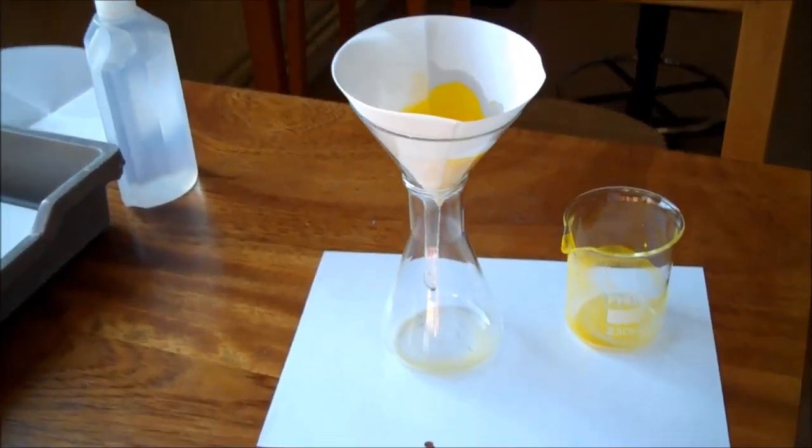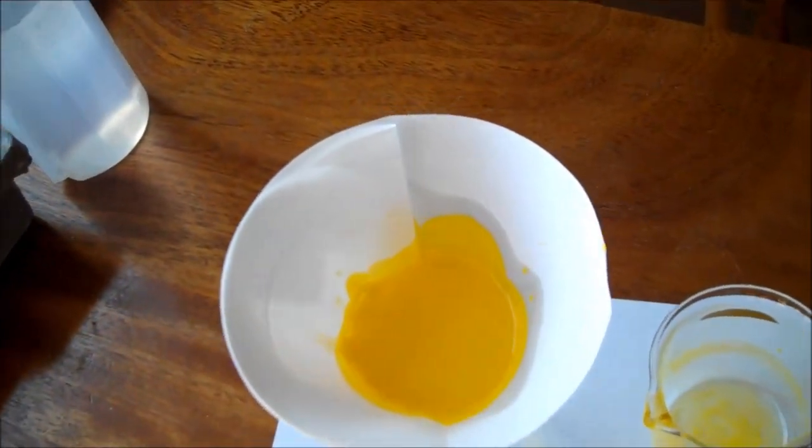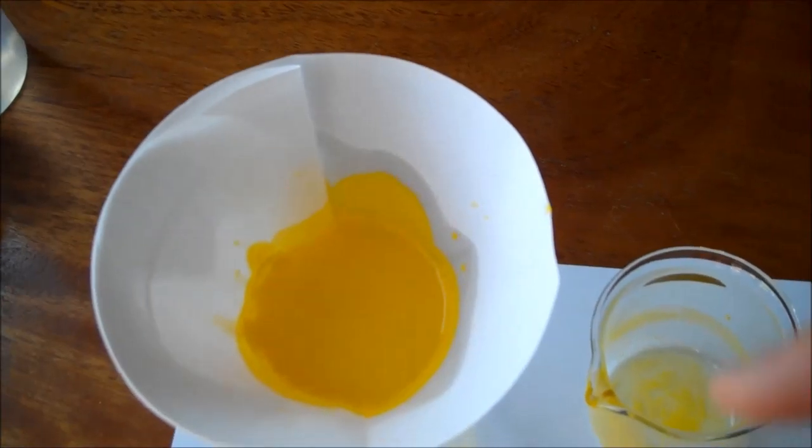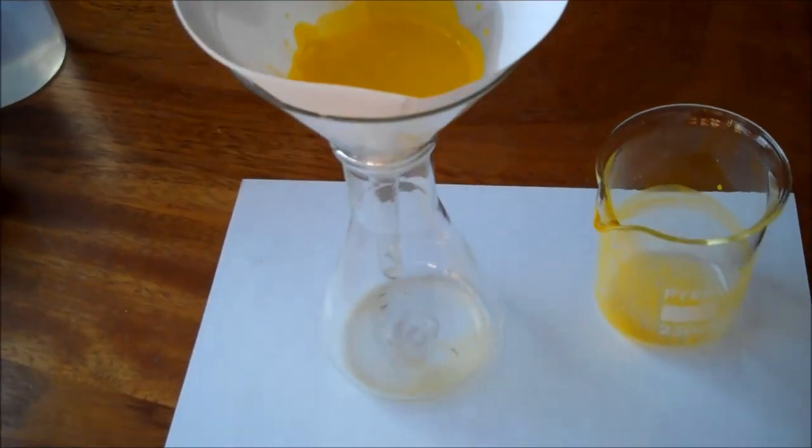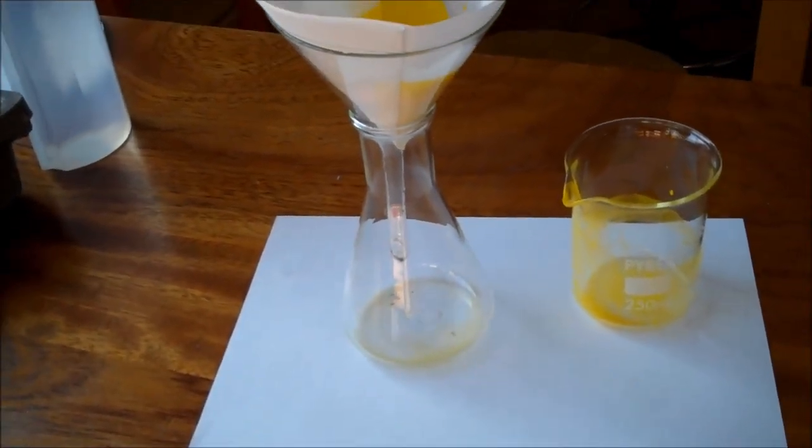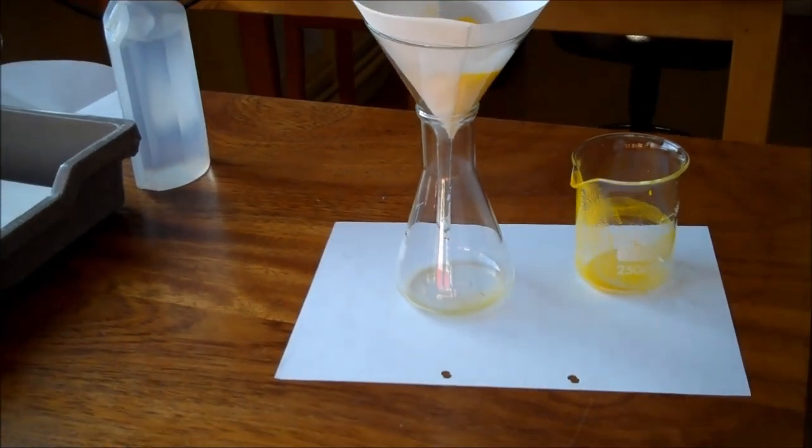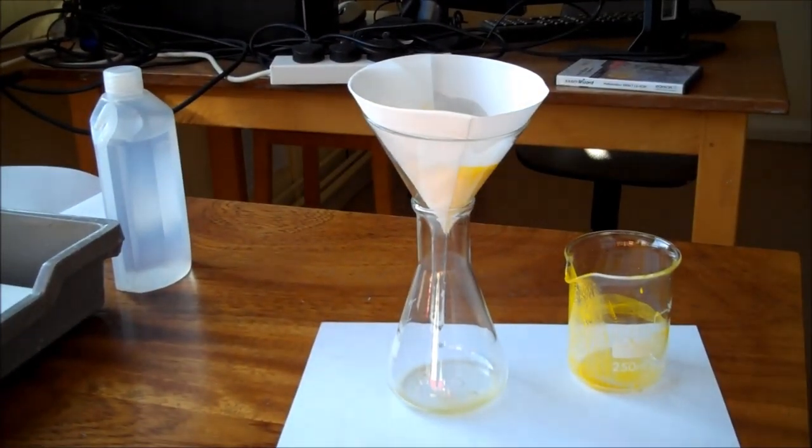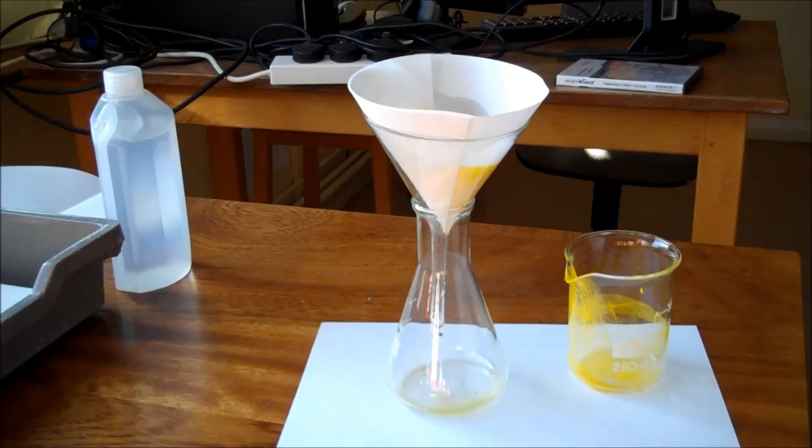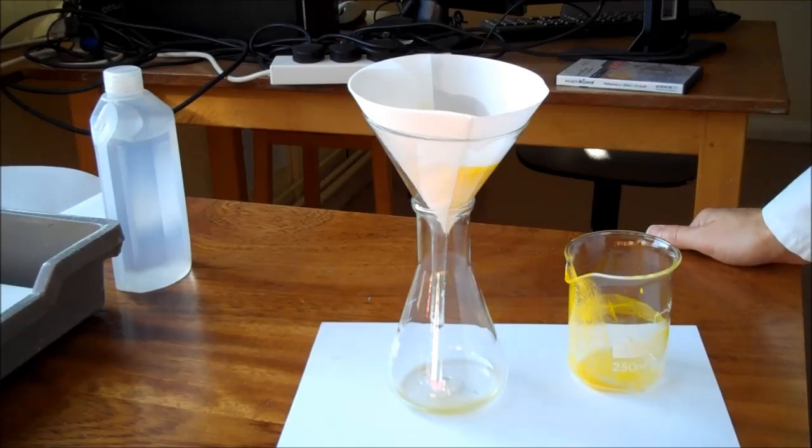Let's have a closer look. You can see that the yellow solid is already sticking and collecting on the filter funnel, and what is filtering through is mainly transparent and colorless, mainly soluble stuff. There's a tiny trace of some yellow solid there but not so much to worry about. That's the first stage in obtaining an insoluble salt, in this case lead iodide.